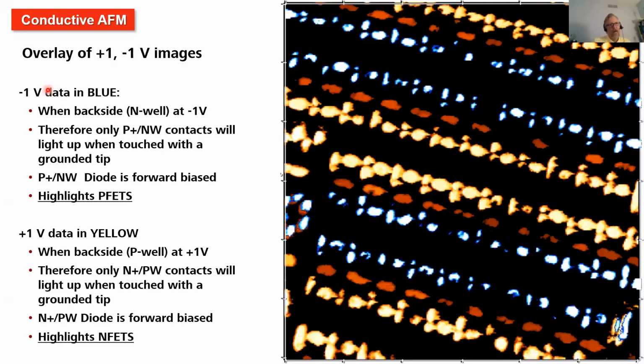Conductive AFM, we have a new module this year. We'll be talking about conductive AFM in the SEM itself. And here's just a quick view of an SRAM array where we've got color coding, where we applied different voltages on the back side of the chip, and we can either highlight PFETs or NFETs, and thereby see when any contact has the junction problem with a quick scan of the whole area.